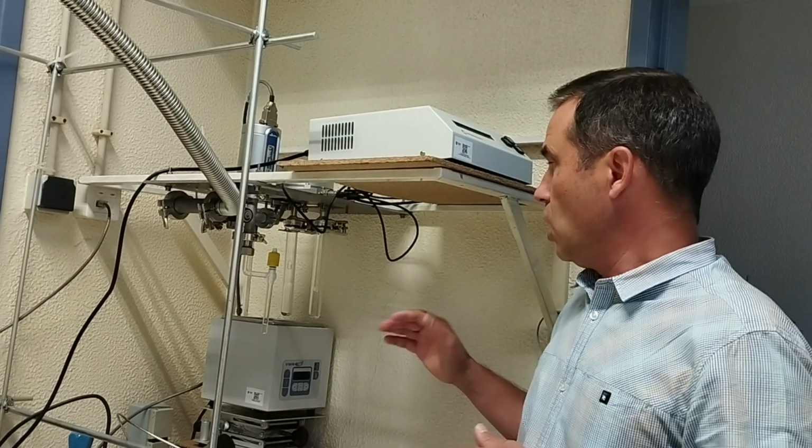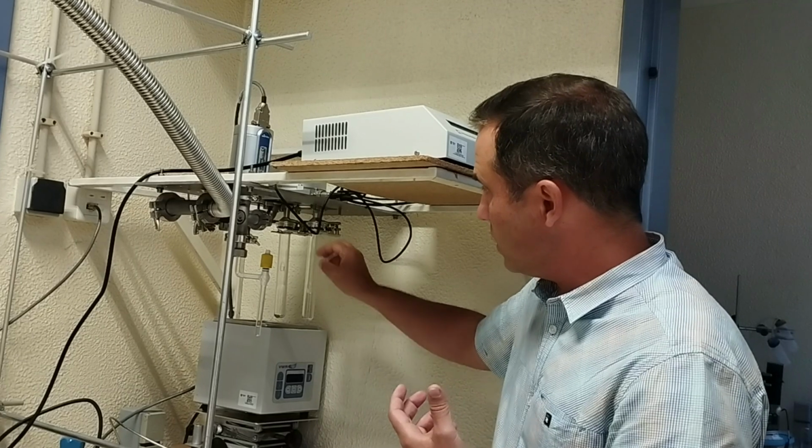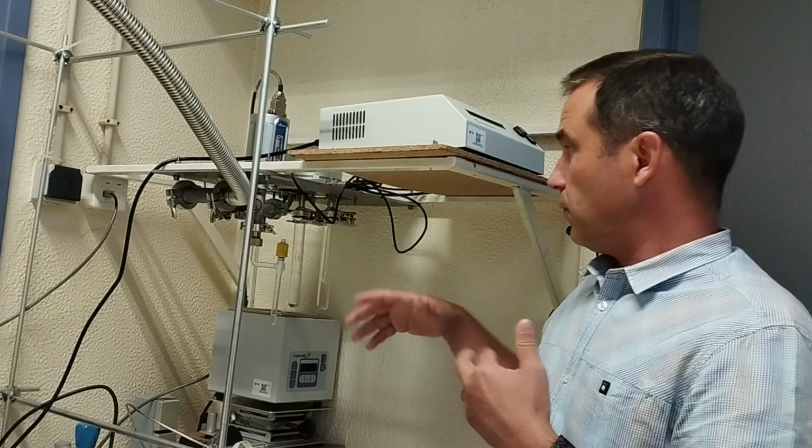In this other equipment that we have also installed in here, we can do adsorption measurements, but instead of being with volumes that are measured, in this case it is through an adsorption balance. We can introduce our samples in here and evaporate small amounts of different vapors, of organic vapors or even water, and assess how much is adsorbed by the materials for different concentrations in the gas phase.